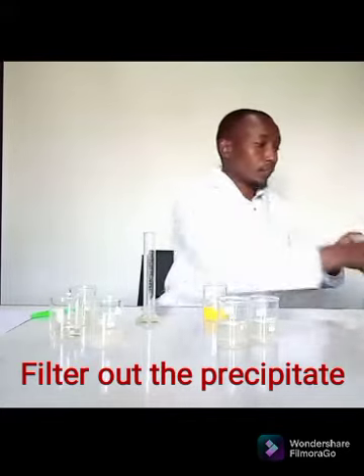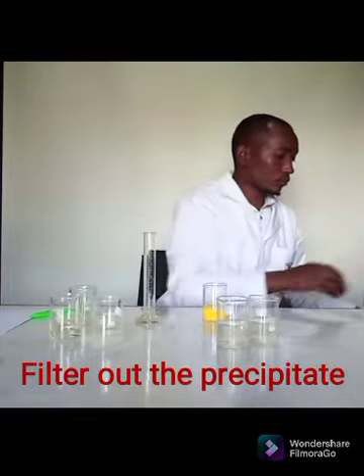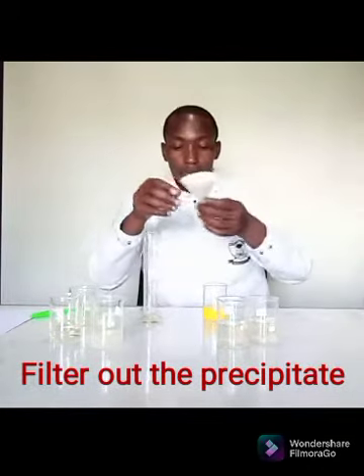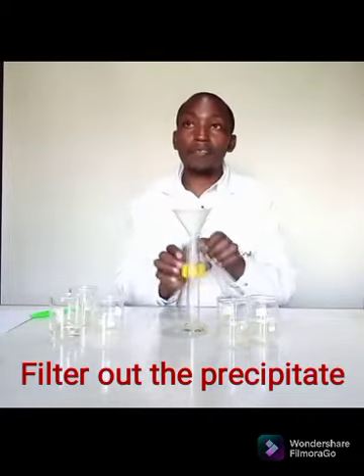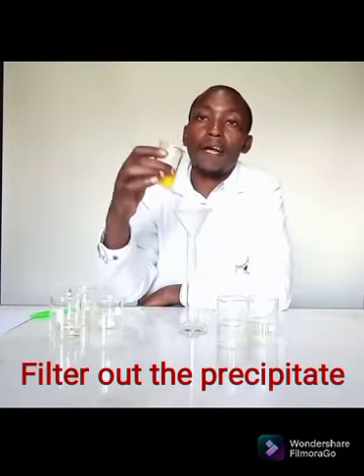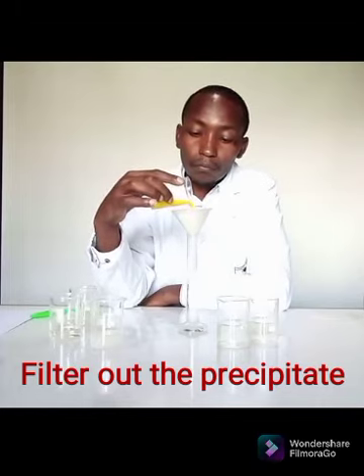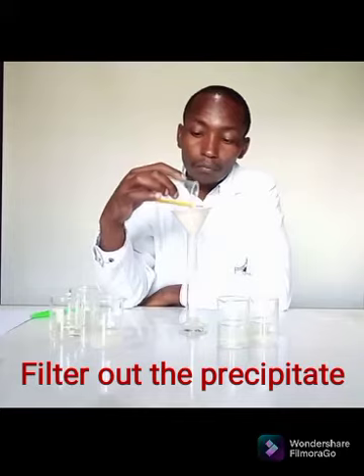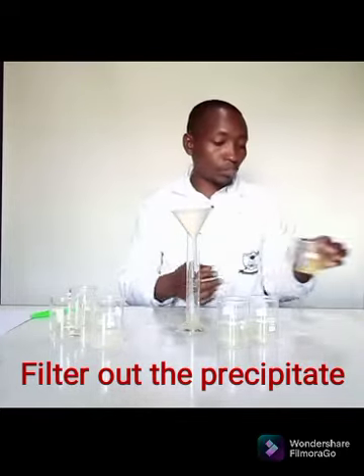Once I lower that in, I'll have the mixture here, then I do filtration.